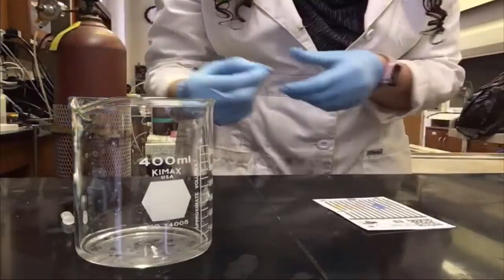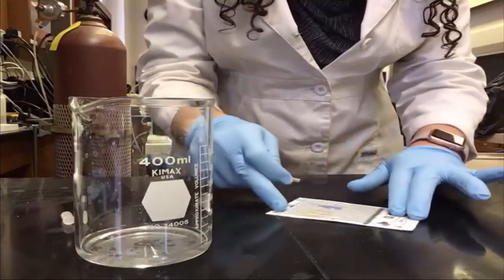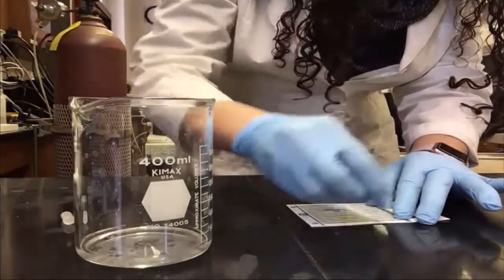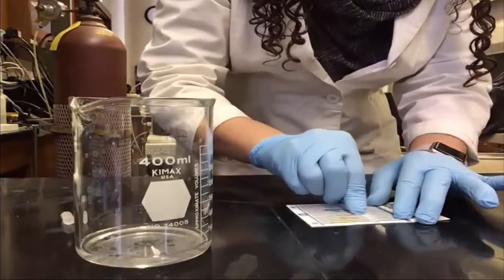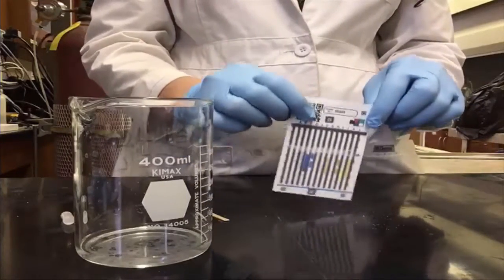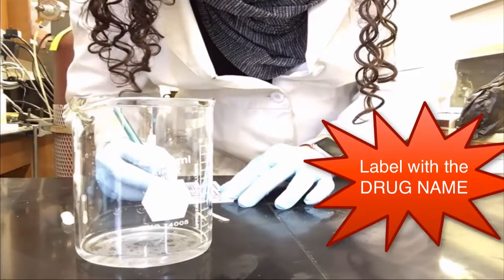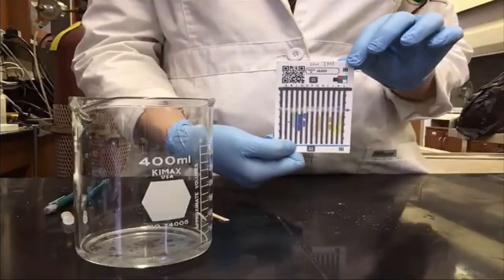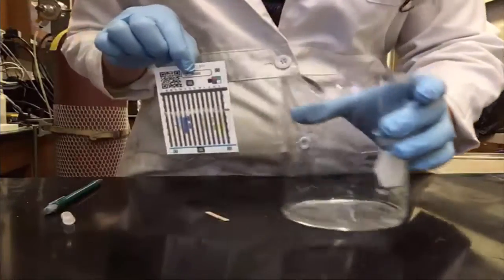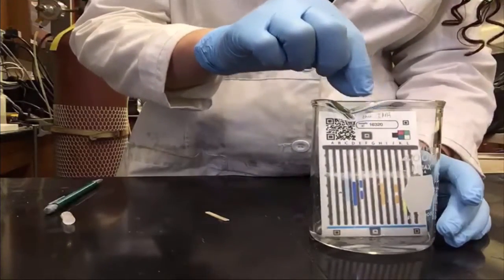Then use a clean spatula tip to rub the powder onto the swipe lane. Use force and really grind that powder into the pad paper. Make sure that the powder is evenly dispersed over all of the lanes. Tap off any excess powder. Make sure you label your pad using a pencil. And then you can put your pad into the developing chamber with a small amount of water at the bottom. Make sure the water is shallow so that it doesn't go above the blue line on the pad.